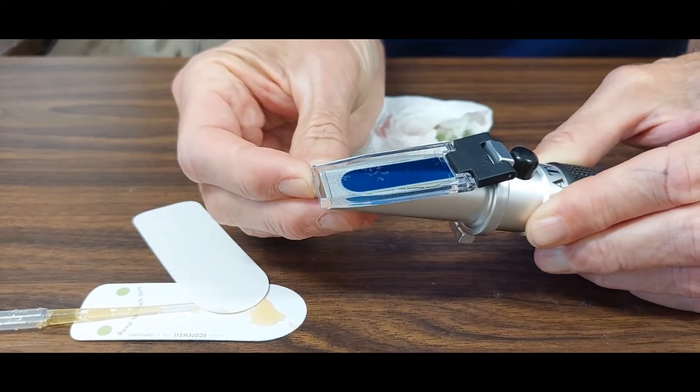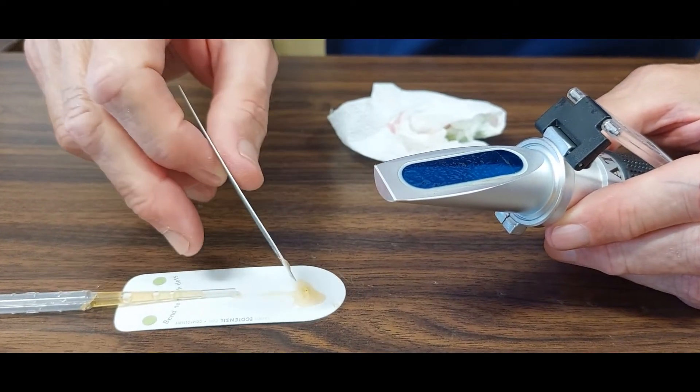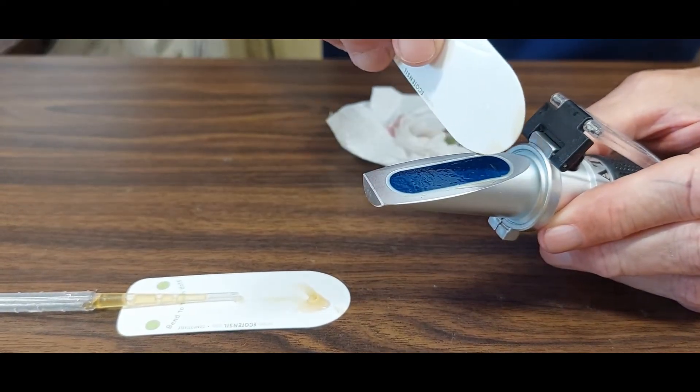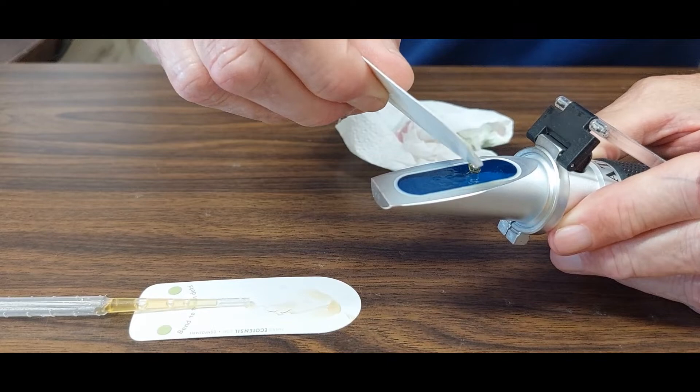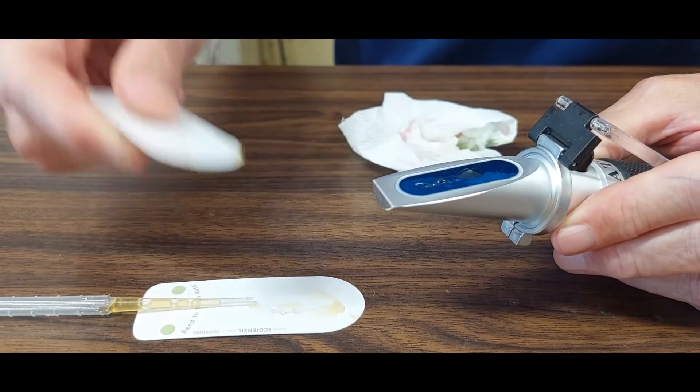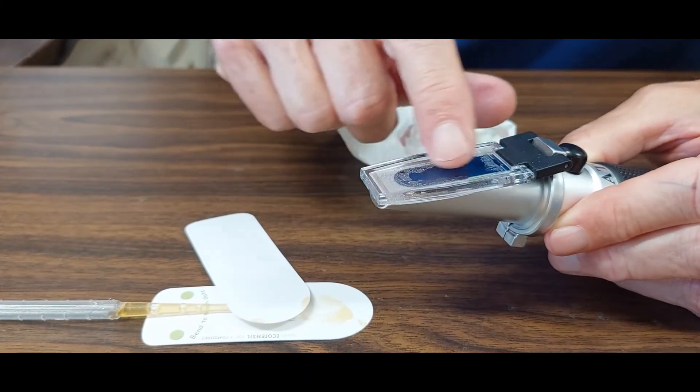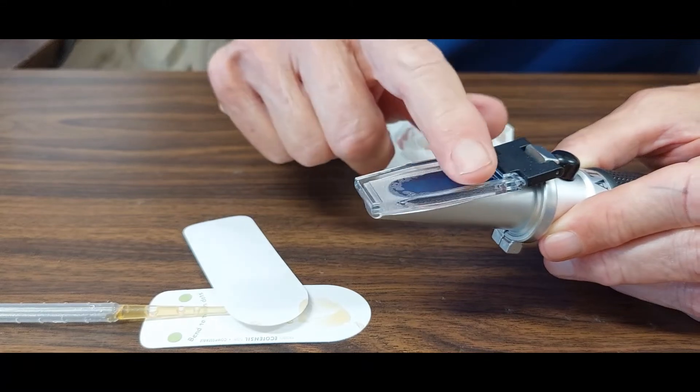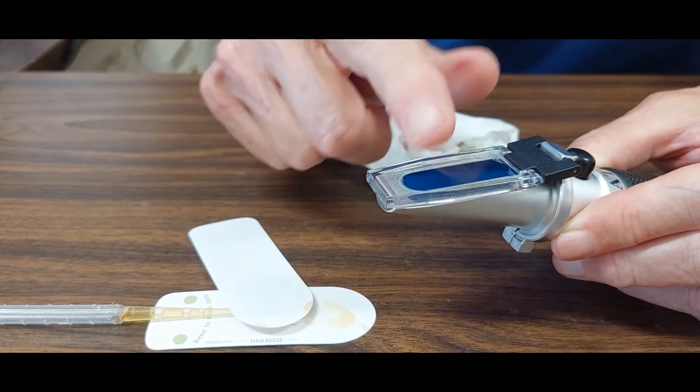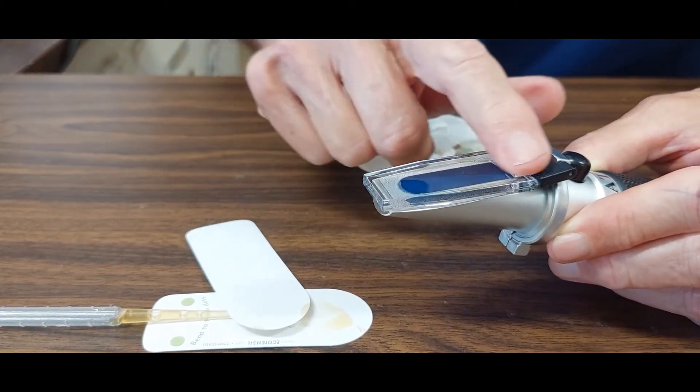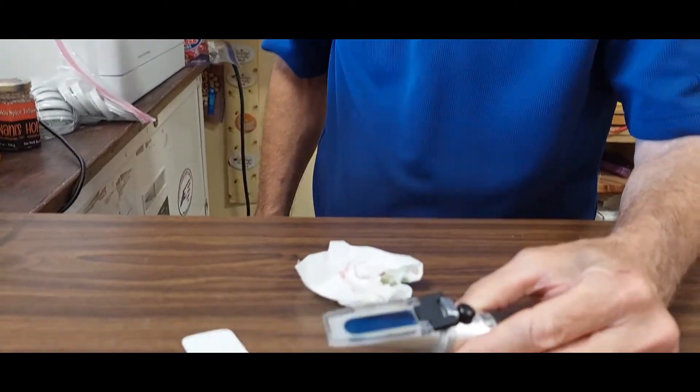Still not there. It does create a section. I am beginning to fix those bubbles too. I think we've been successful now. Okay that's completely covering I don't see any bubbles there.